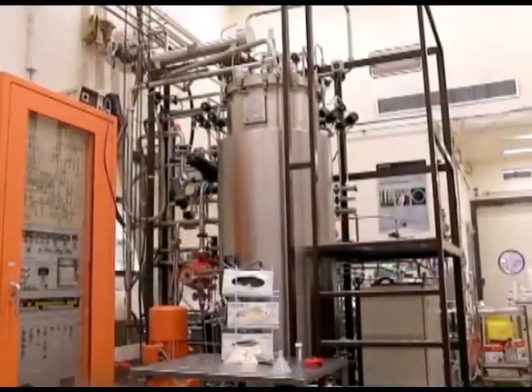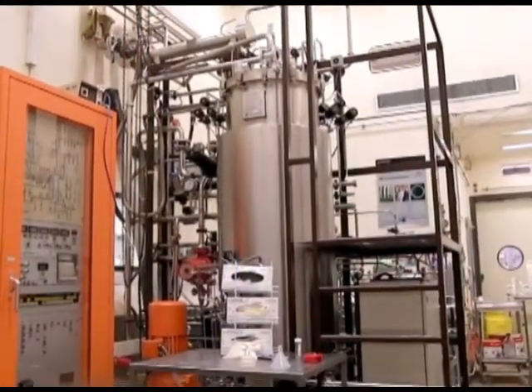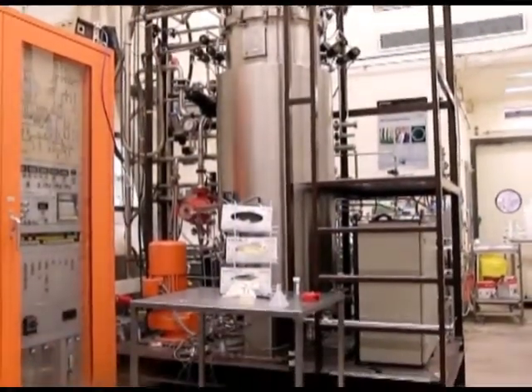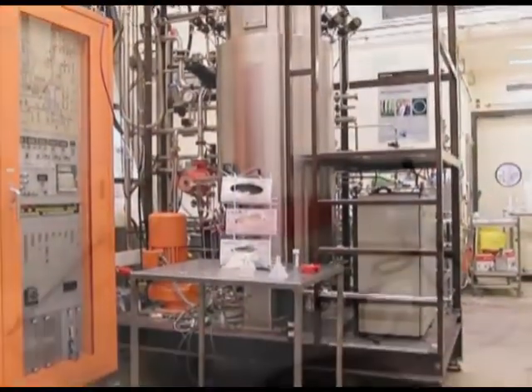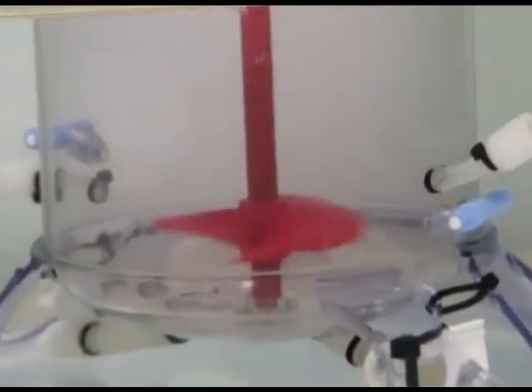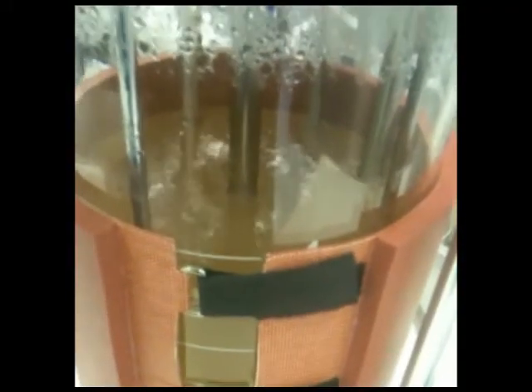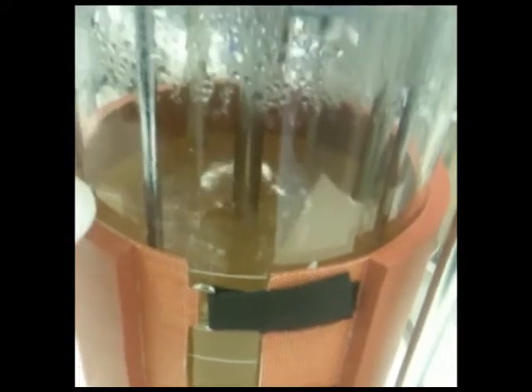The vessels themselves are usually cylindrical steel tanks with a rotating impeller located inside to keep a steady flow of well-mixed nutrients and gases. It turns out this process of mixing is crucial to produce healthy cells and organisms.